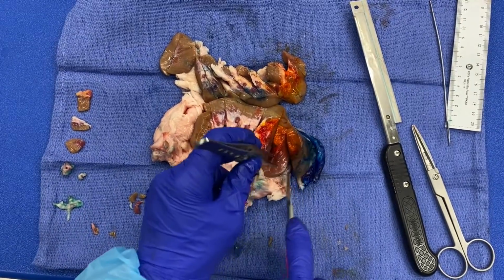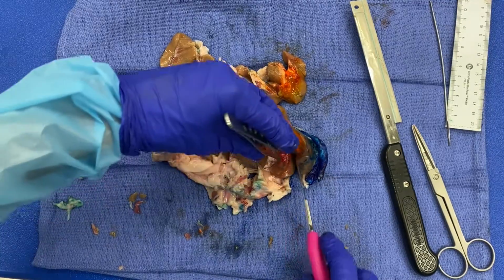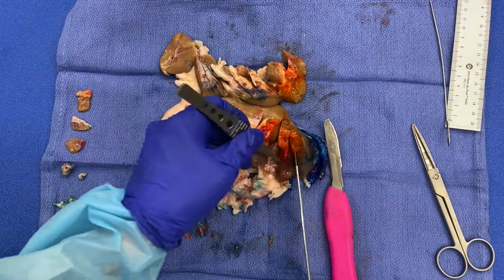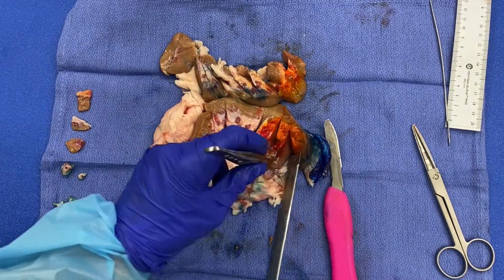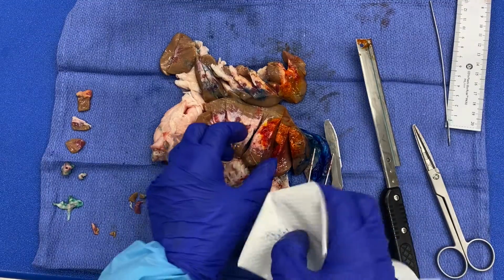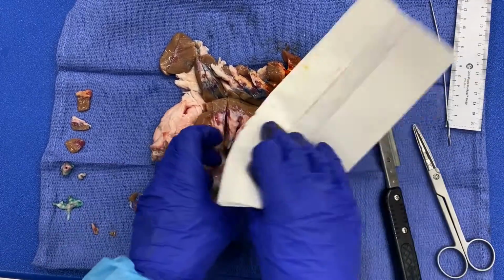So sometimes the adipose tissue is really adherent and it doesn't move around as much. Other times it can be a little looser like this. So either way, even if it is loosely attached, like in this situation, you're still gonna want to get a section in relationship. And all you're gonna do then, right, is cut your tissue, and it's a little wet, so I'm actually gonna dry it a little because it's moving around quite a bit on me. So I wanna be safe and not cut myself or damage the tissue in any way.